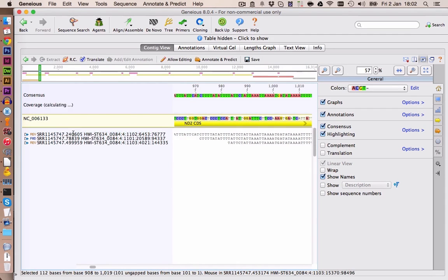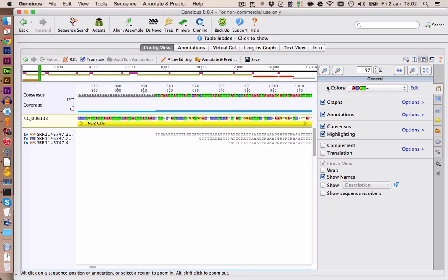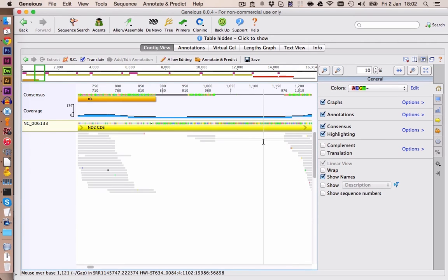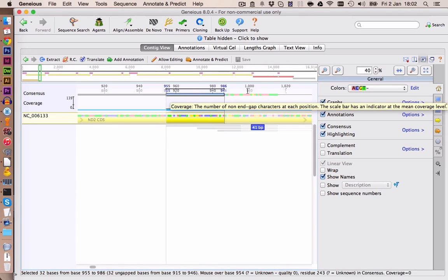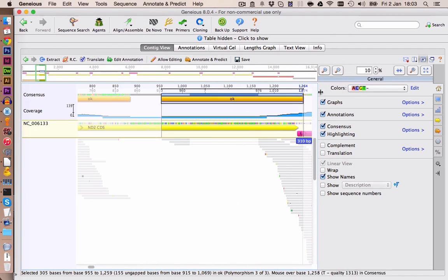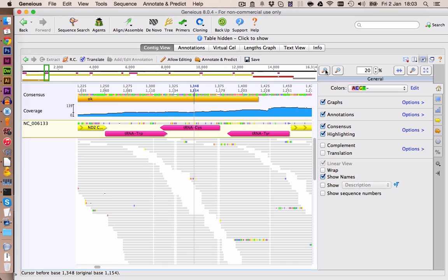So let's delete this one here. And we move those one backwards. Well, actually we can keep them because the consensus has a gap here as well. So this will be removed automatically. So we can go ahead and add a new annotation. I will finish this now for the complete genome and show you any interesting spots, if there are any.